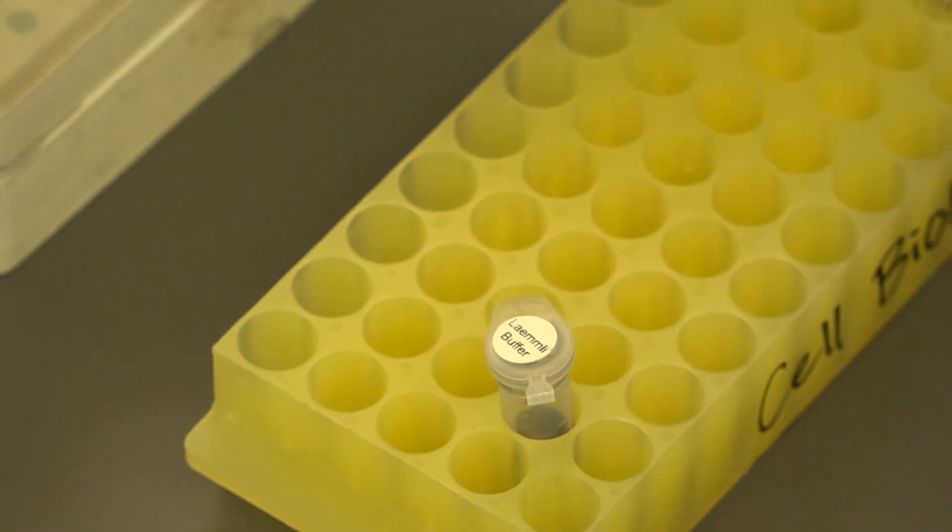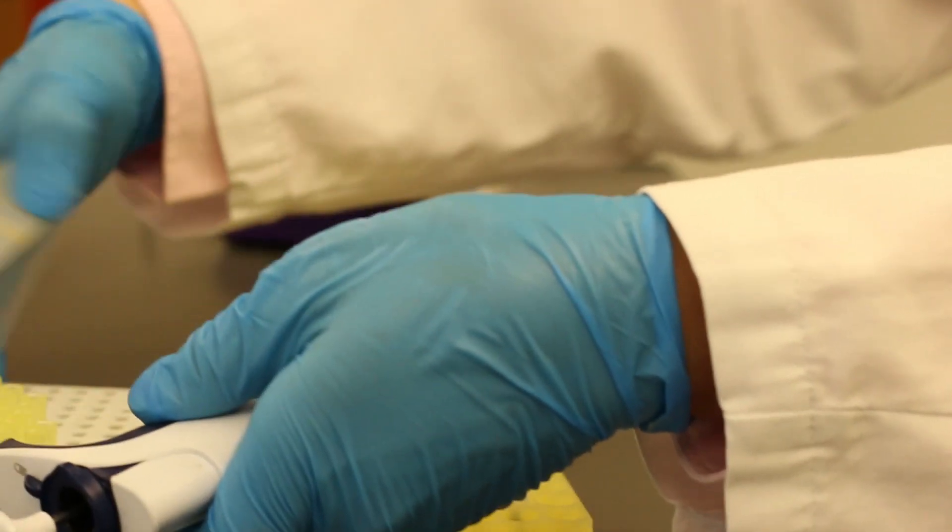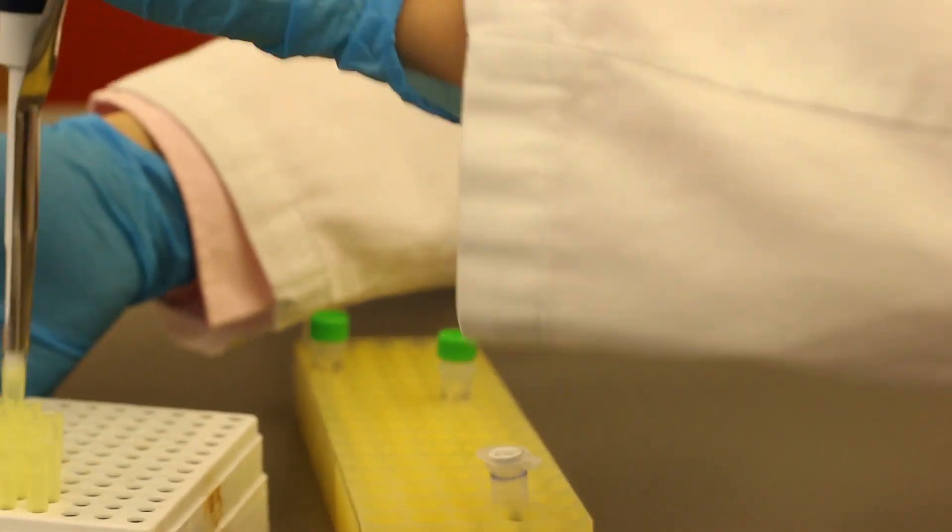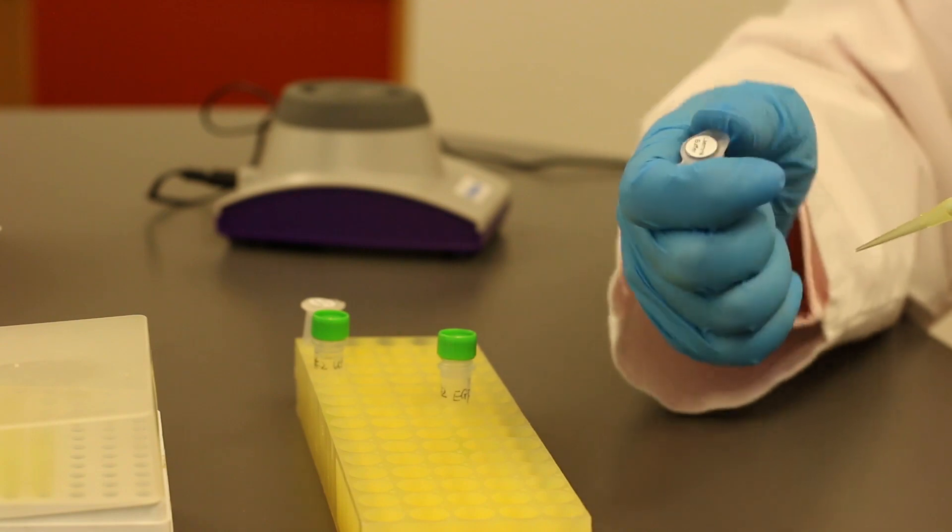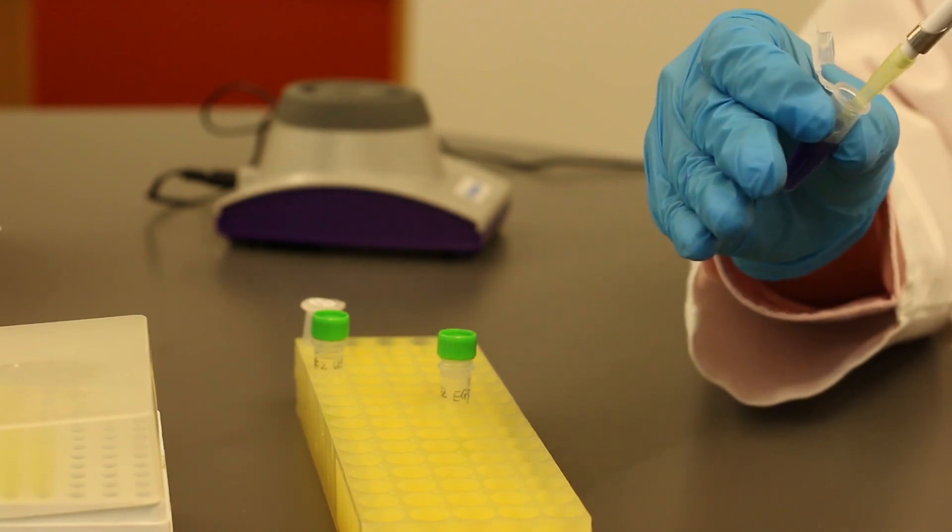As Laemmli buffer is very toxic and smelly, be sure to wear safety goggles and gloves when handling this buffer. And keep the tubes containing Laemmli buffer capped when not in use.